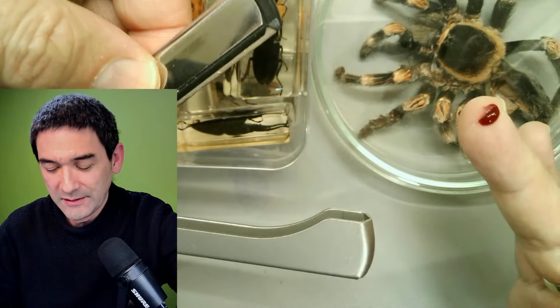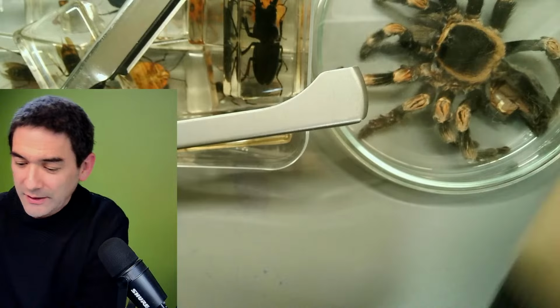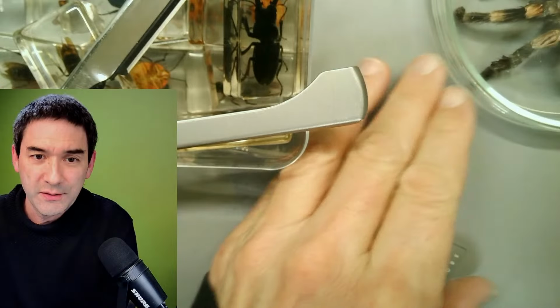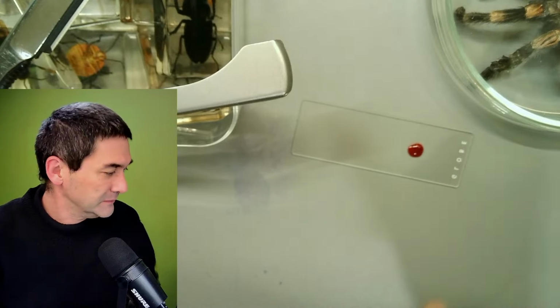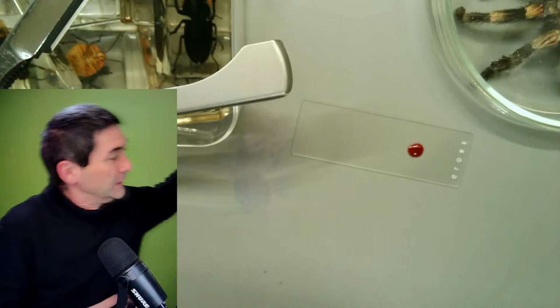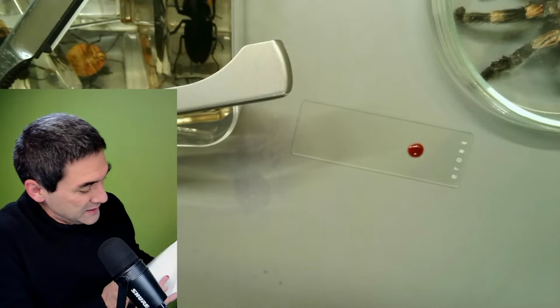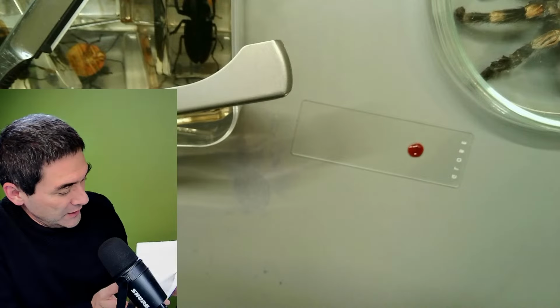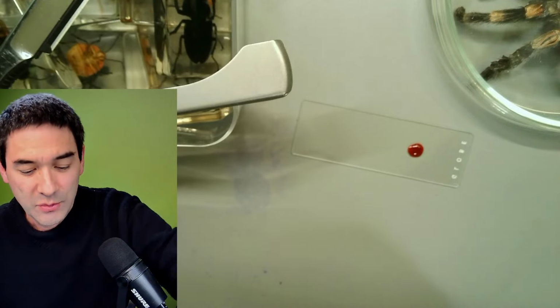And of course, what am I supposed to do now? Gee, of course, I'm changing topics again. Yeah, and I have to get myself now some tissue paper. You always have to. You see, that's what I mean with changing. Improvising a little bit, and let's do the following.